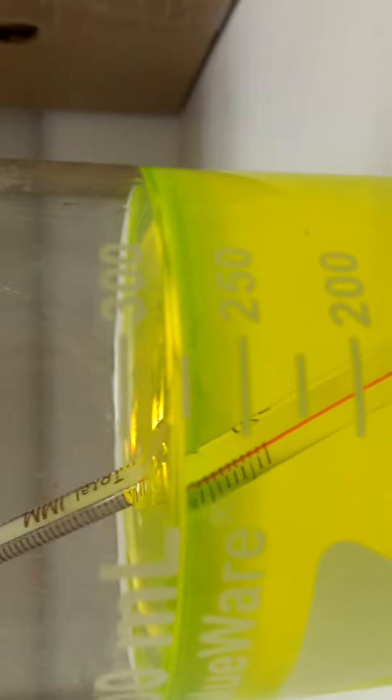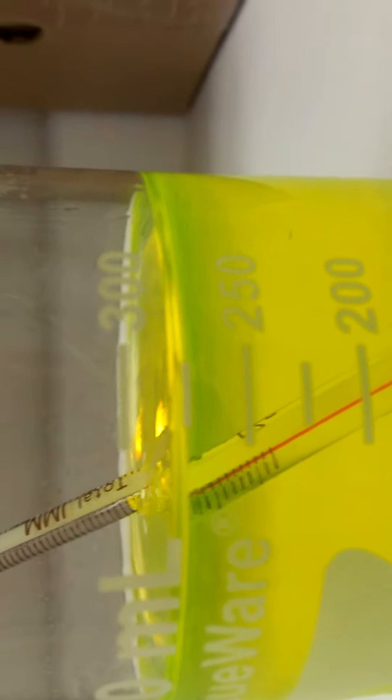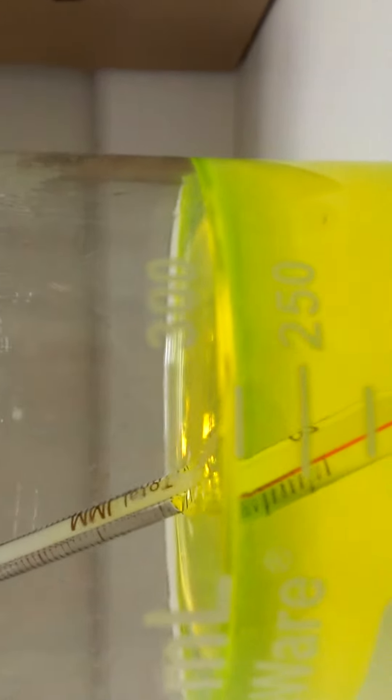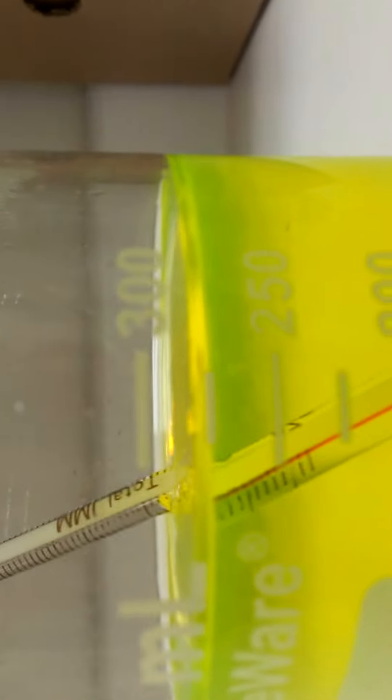It was above the 300 by about 50 milliliters. And now, it is at the 275 mark.